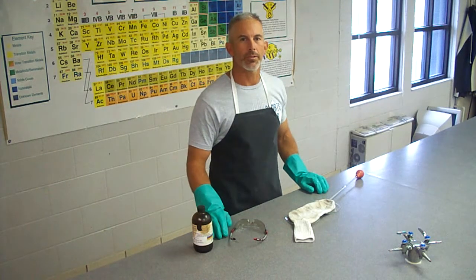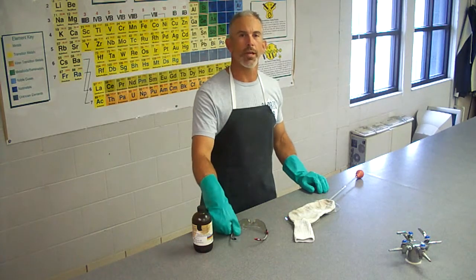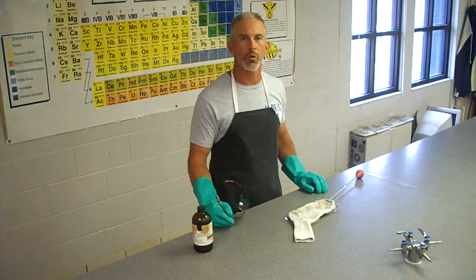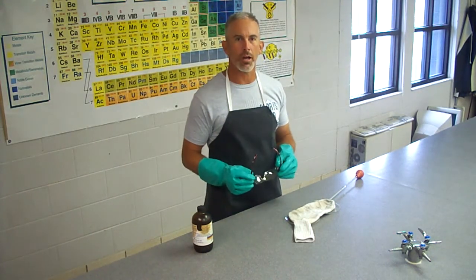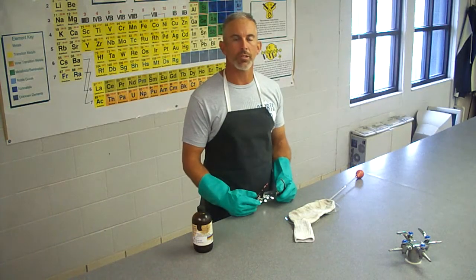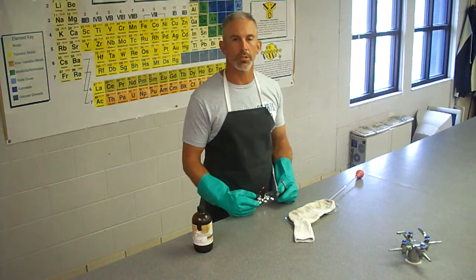Welcome to chemistry class. Today's demonstration will be on the importance of lab safety. As you know, safety in the chemistry laboratory is extremely important, and so we cover that at the beginning of every school year. Today's demonstration, I'll use a regular cotton sock, and I've got some sulfuric acid here that I'm gonna use on that sock to demonstrate the effectiveness or the corrosiveness of this particular substance.